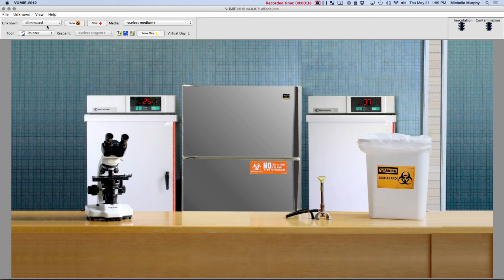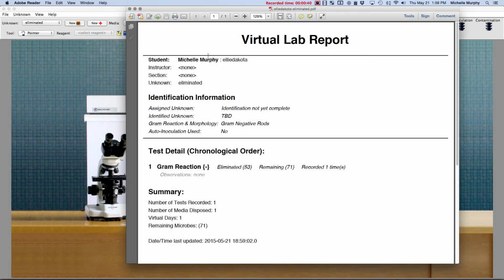If you go to lab report, you'll see it's already been started for you. It tells your name, it tells the date you did the lab, it says you did a gram stain. When you did the gram stain, your choices were positive or negative. By choosing negative, which was correct, you've eliminated 53 possibilities and you have 71 remaining. Within the program are 124 microorganisms. The point of the program is to keep doing tests until you narrow it down to one.